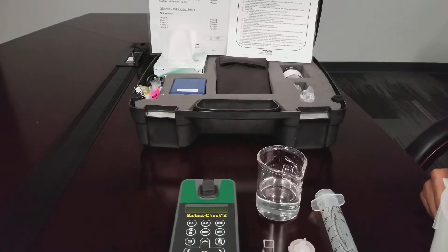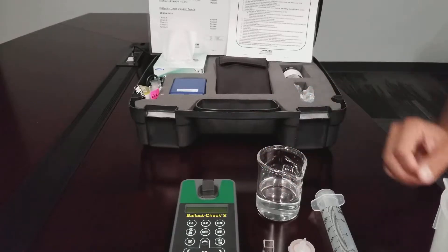This procedure will describe how to measure a sample using the Ballast Check 2. These are the items required to measure a sample.